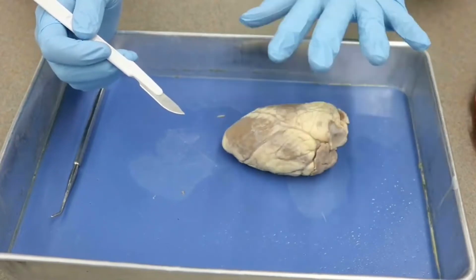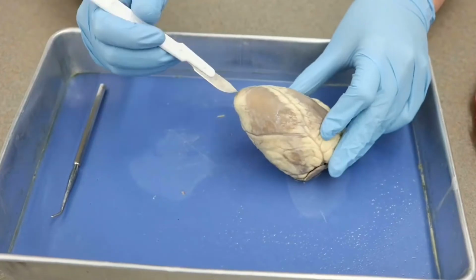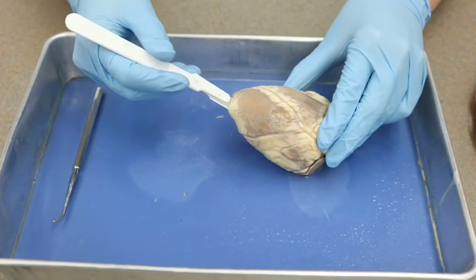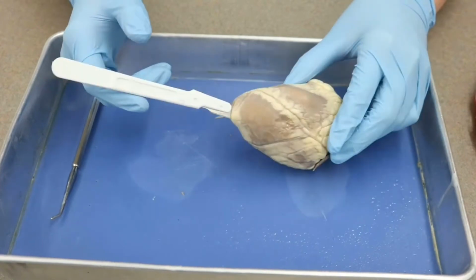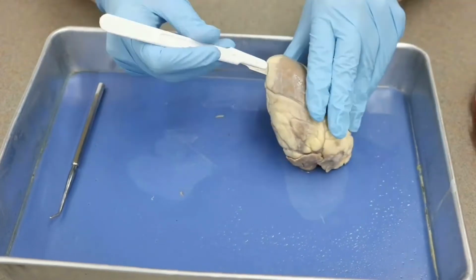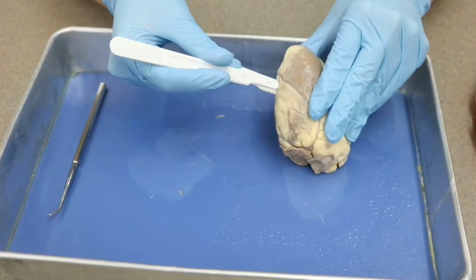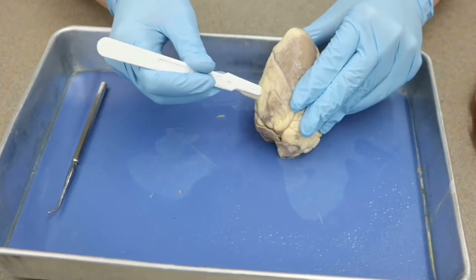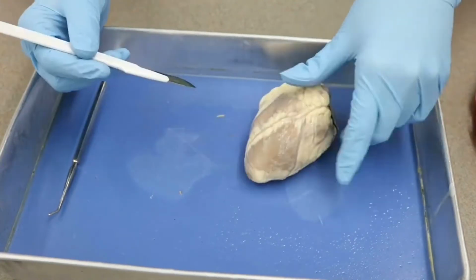So with the sheep heart, there's several different ways that you can do the dissection, but what we're going to do is we're going to go ahead and find the apex of the heart and put your scalpel in like that, just so you're about to the end of the blade, and then you're going to slowly cut up through the left side of your heart. You might have to do a sawing motion to make it work, or you might be able to just go straight through depending on the sharpness of your blade and the ease of your heart, okay?